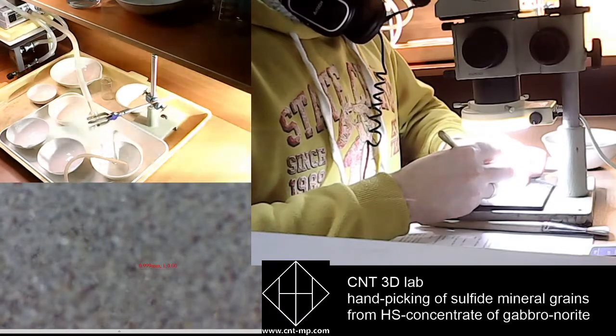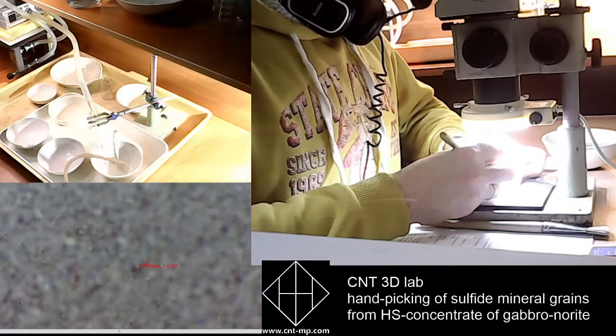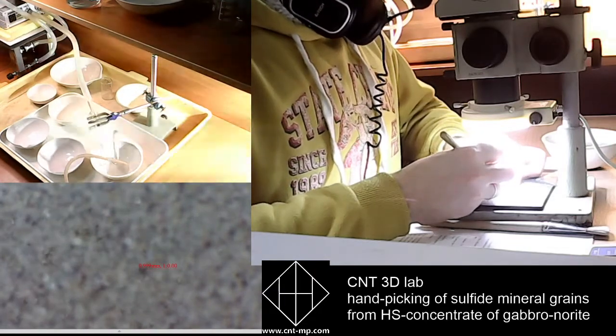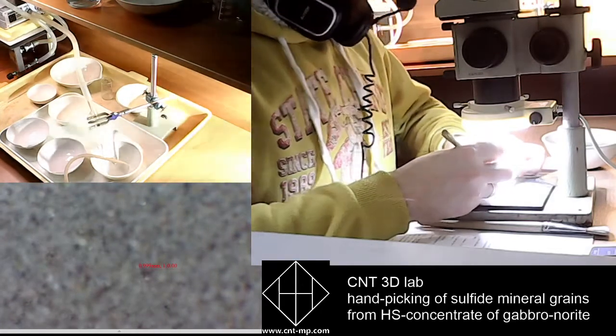Also, there are a lot of octahedral grains of magnetite or chromite. Oh no, it's magnetic, so it's magnetite. Okay. Another chalcopyrite grain.